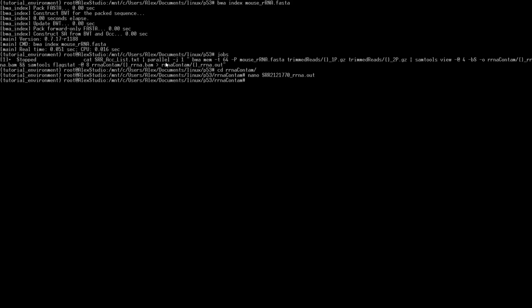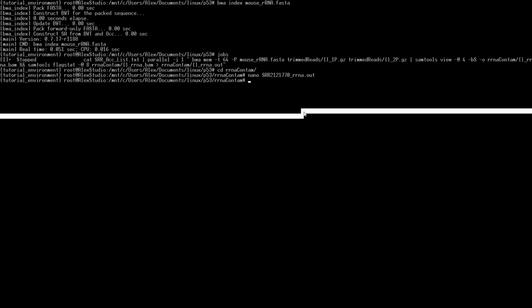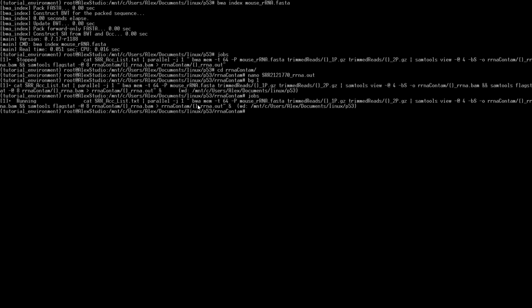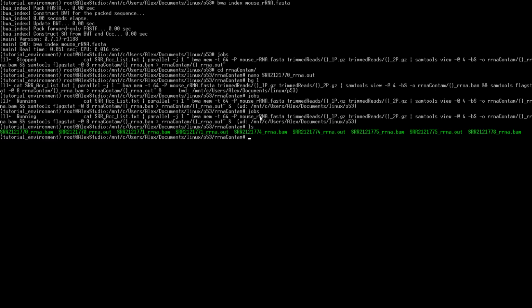Now back up here. When we run this, we're just going to feed in one job, one at a time, but this all should run through all of our accession numbers. Go ahead and continue that. Since it stopped, we can do bg and then 1. Jobs, we got it running again. So the important thing with this is that we're not saving the SAM file. We just have our BAM file and our output file. We're not going to use too much storage space to store our SAM file. We go back up. That's checking for rRNA contamination.